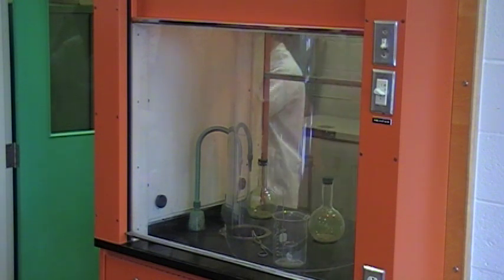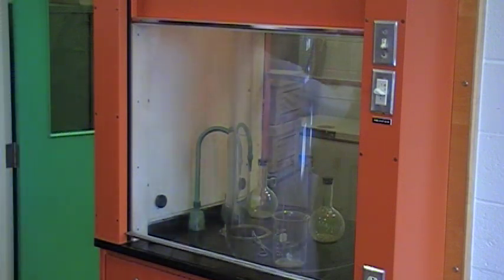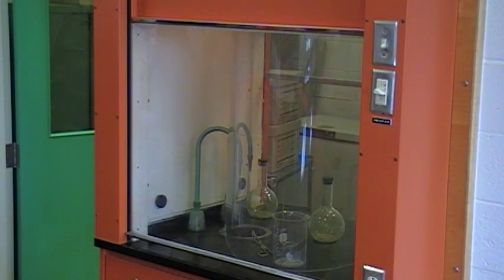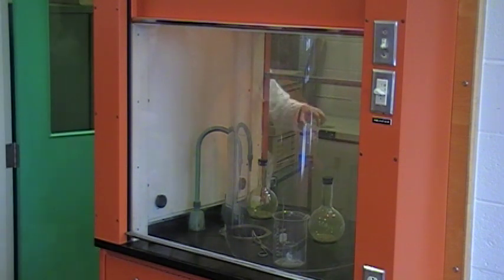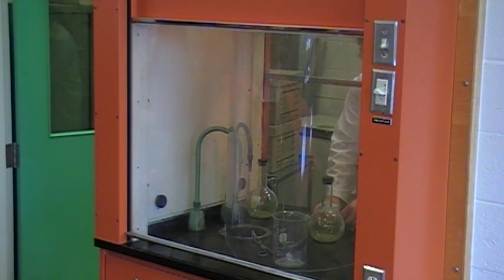I've got my sodium in here, it's the darker drops of metal. Some of you probably won't be able to see it, but the darker pieces are in there. It's under oil, because sodium will actually explode under water. It's quite unpredictable stuff, but I've tried this one before, so there's nothing for you guys to worry about.